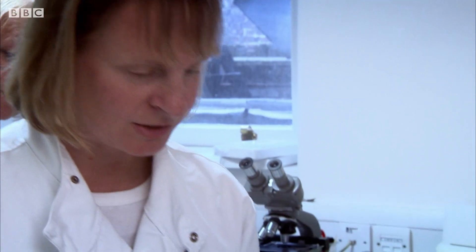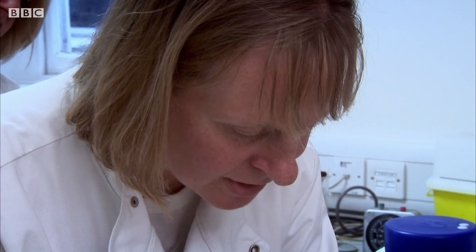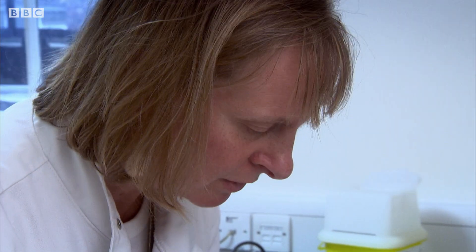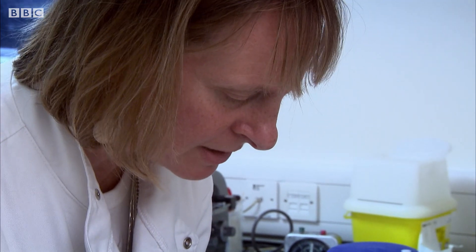In terms of the tissue bank, they're still interested in keeping normal tissue as a good control. They select an area to freeze down, dissecting out very small pieces so they freeze rapidly. These pieces are placed onto ordinary foil, which allows multiple pieces to be frozen simultaneously.